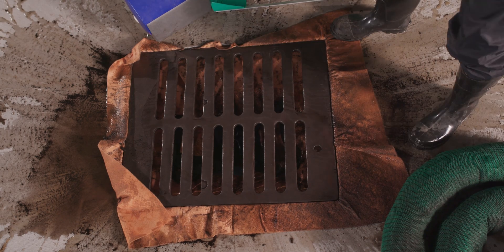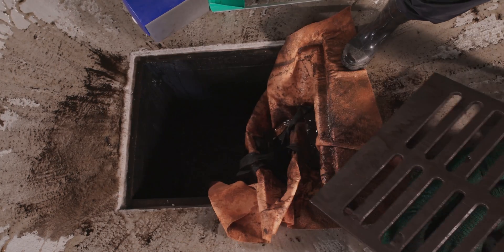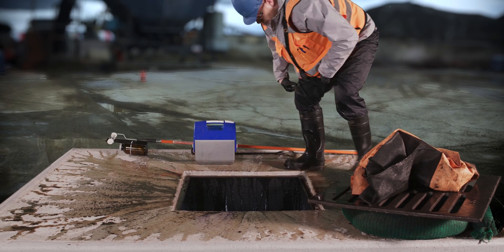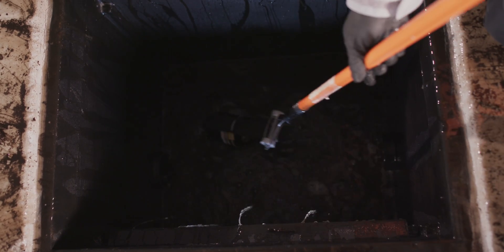Collecting representative stormwater samples from drain inlets can be challenging, especially if there is a drain insert bag or other BMP installed. It looks like our sampler is struggling with the drain insert bag. Having drain insert bags at sampling locations is almost always a problem because any time the bag is disturbed, it releases trapped pollutants and sediment back into the stormwater and right into your sample bottle. It looks like he's then collecting a sample from the conveyance pipe at the bottom of the catch basin — but that was not the best way to capture a representative sample.